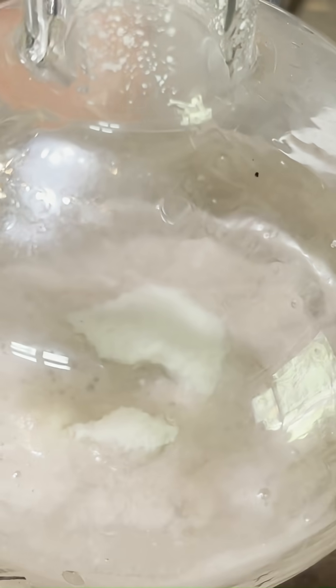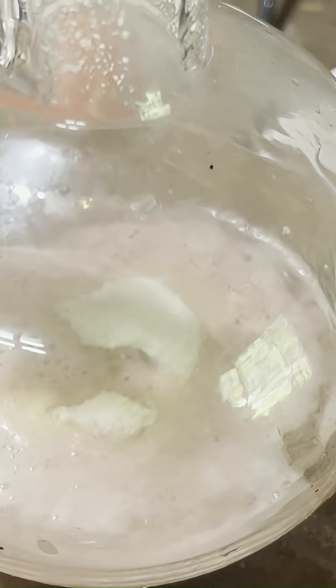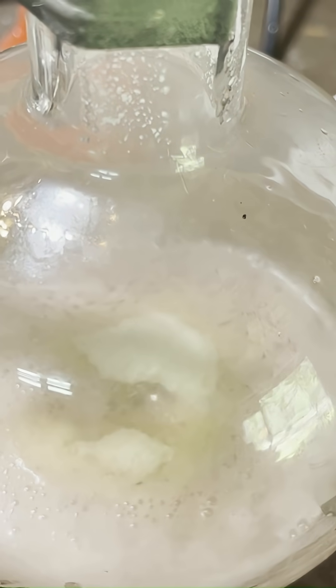What this is doing is the potassium nitrate is reacting with the sulfuric acid. The potassium nitrate is becoming potassium sulfate or bisulfate, and the sulfuric acid is becoming nitric acid. It's doing a double replacement reaction, I believe.